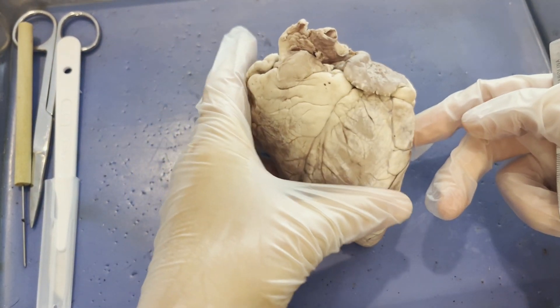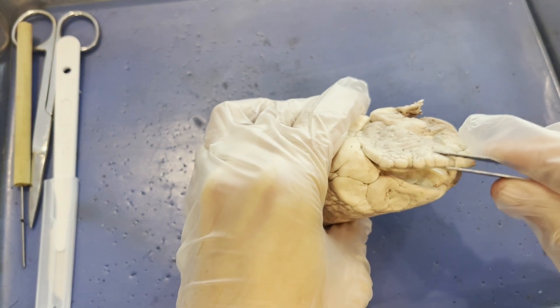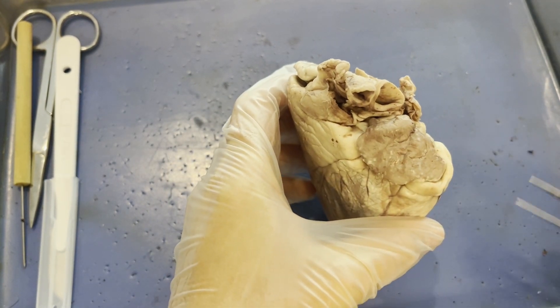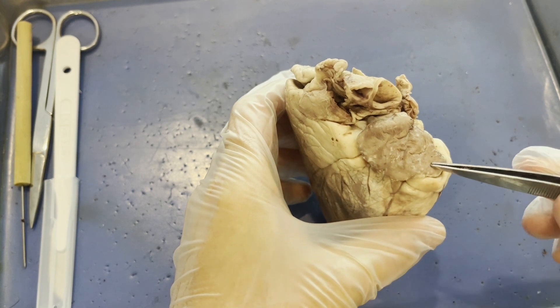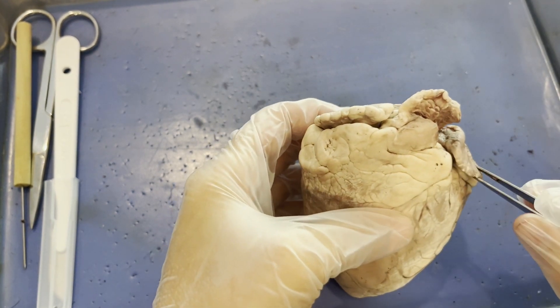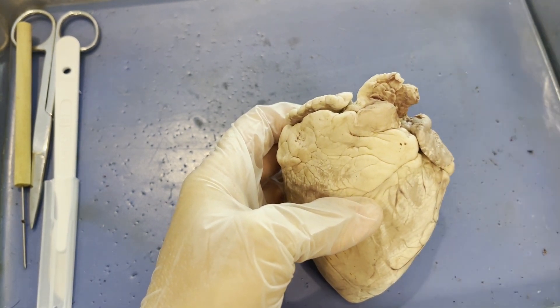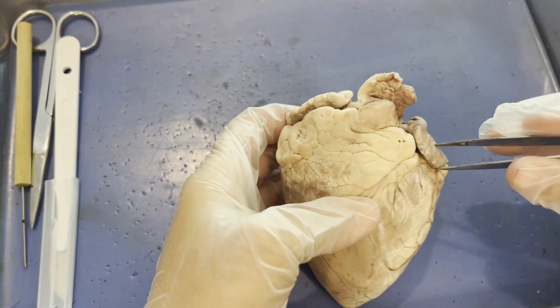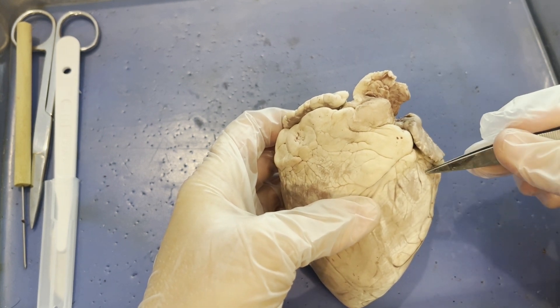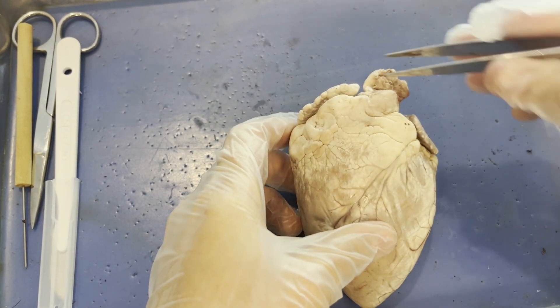Above each atrium you will find these little flap-like structures called the left and right auricles. That word descends from the word for ear — someone at some point thought this looked like an ear. The auricles are associated with the atria but are not the same thing. They are pouches that, when blood enters the atria, can increase and stretch out the volume of the left and right atrium.